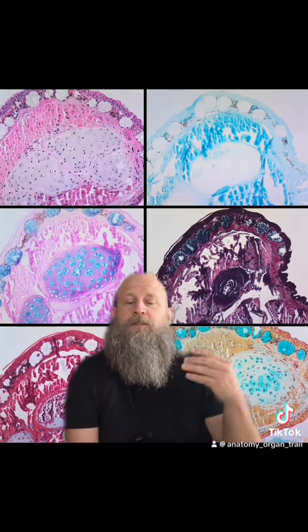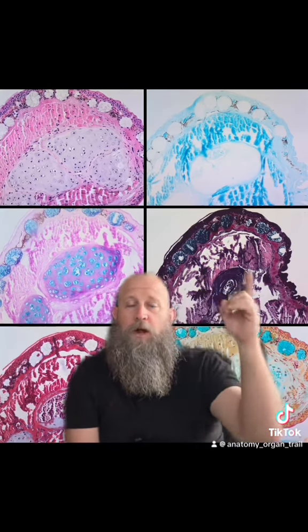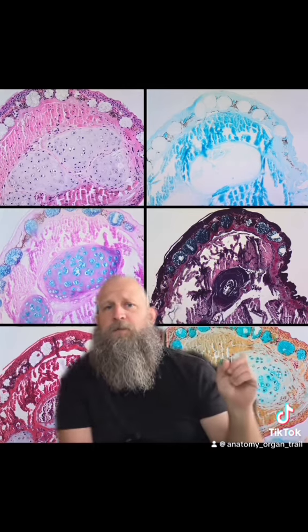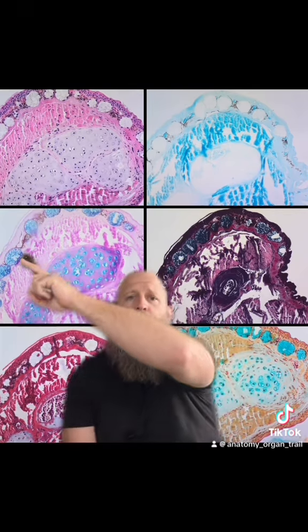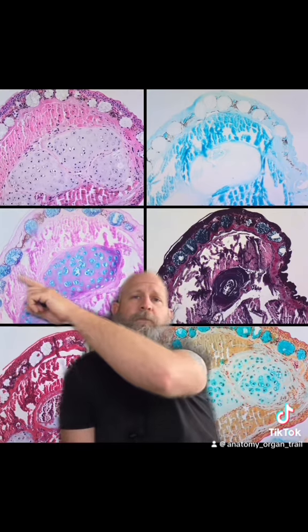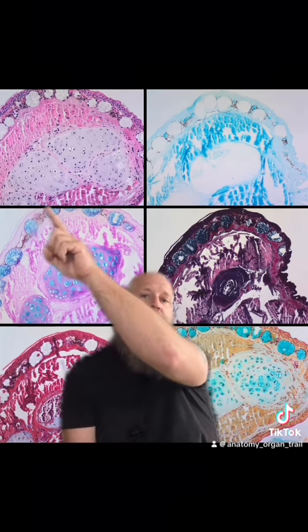So for an example, this is the toe of a salamander cut in what we call a cross section. And I stained specifically for mucins, and I know that these glands here and these glands up here are mucus producing glands because they highlight that color for mucins, that blue color. So I know that these glands are producing mucus, which differ from some other glands that I have inside of salamander toes that are not producing mucus. They're producing something else. And that allows me to see the difference between what's happening in the glands, even though they might look the same if I use just a general stain.